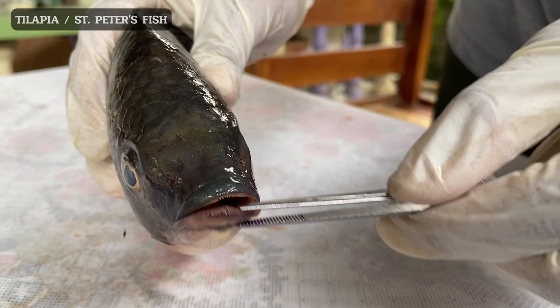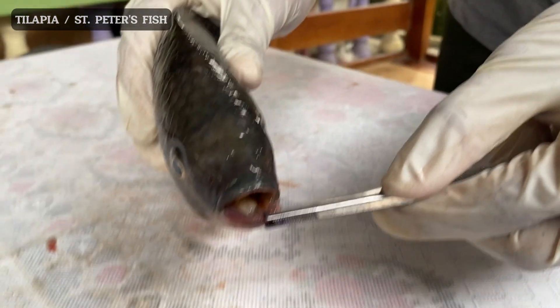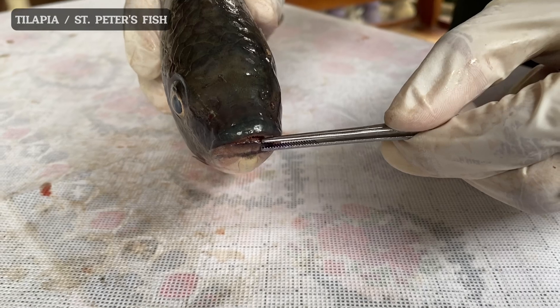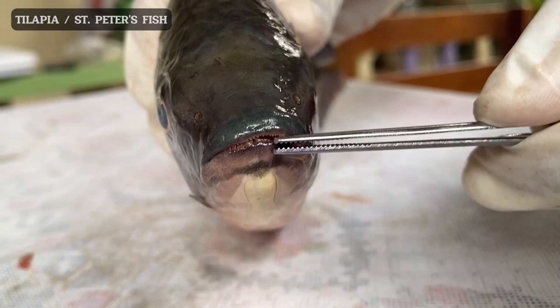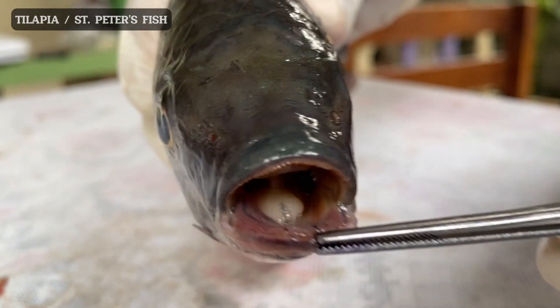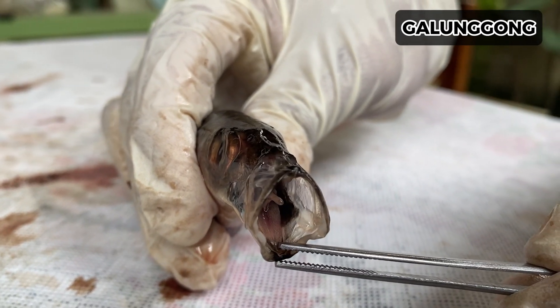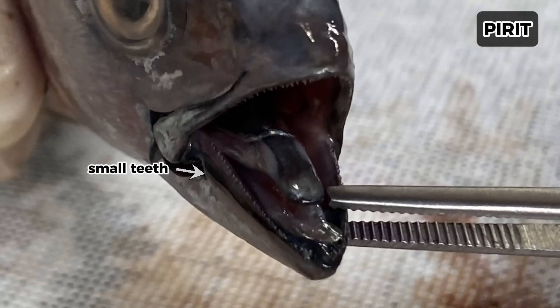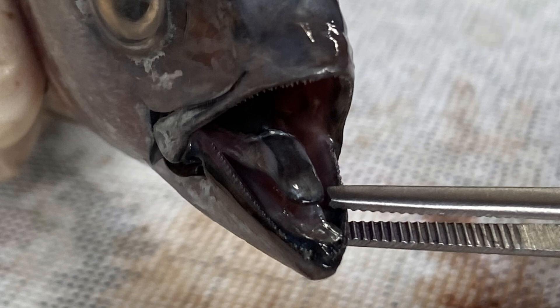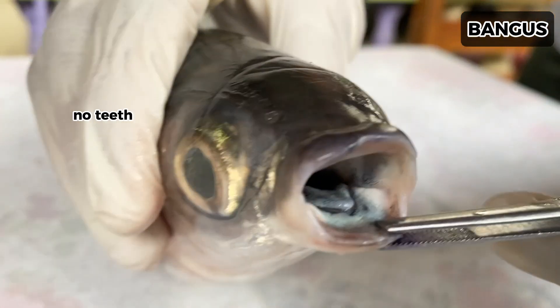Next, we will open the mouth of the fish and notice the motion of the jaw. Not only do fish use their mouths to eat, but also to pull in water in order to take in oxygen, which is why their mouths are able to open wide. Some fish can open their mouth wider than others — for example, the galunggong, which can open its mouth very wide to catch prey. As you can see inside the mouth, the tilapia has small teeth that help it grasp prey, similarly with pirit, and unlike the bangus and matambaka, who do not have teeth since they generally feed on algae and invertebrates.